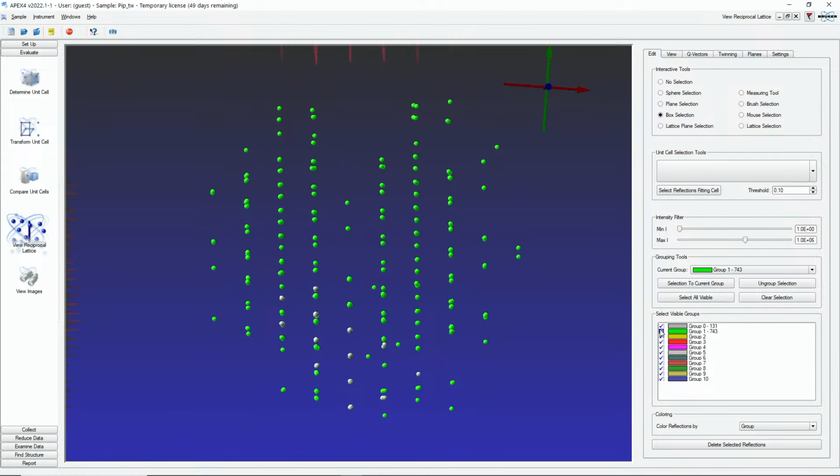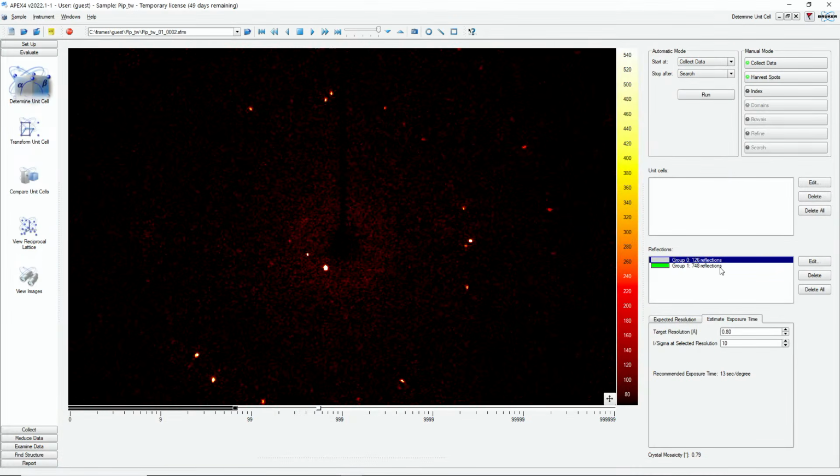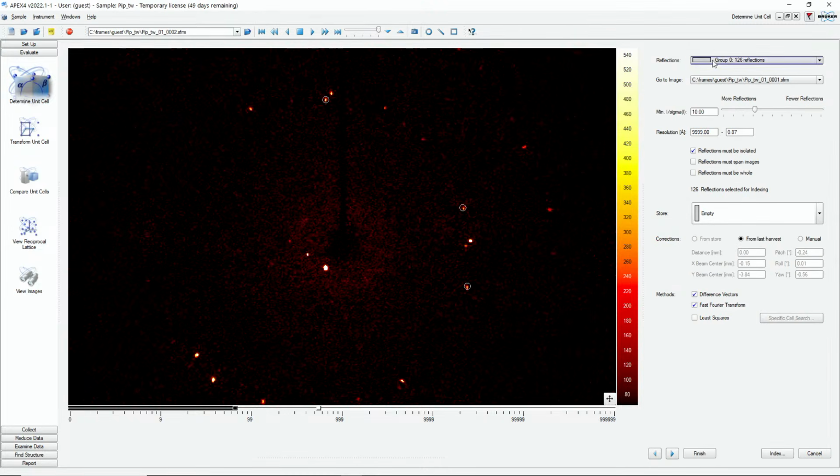So when I turn off the green one now and rotate this, you see we now have a pattern that looks much more like a single crystal pattern. What you can also see here is I selected a couple of reflections that shouldn't be there. I will just use the box again, and we'll put those also into the green box. When I go back to indexing, you see now that we have two bins, the gray reflections and the green reflections. So now we will index the green reflections into my green container for a matrix.